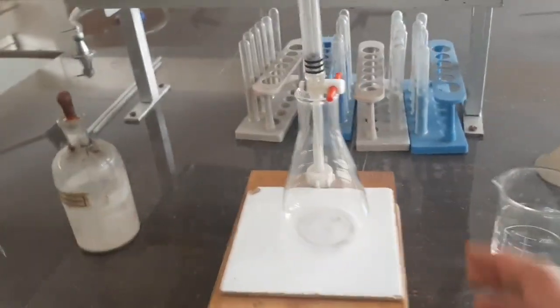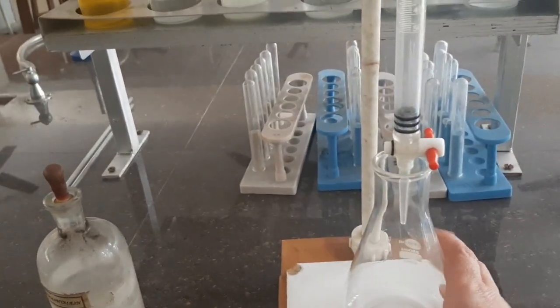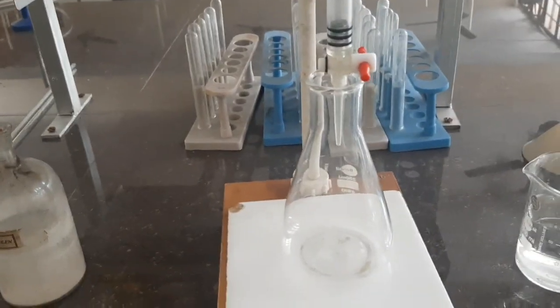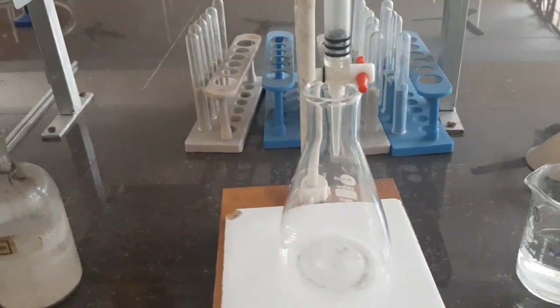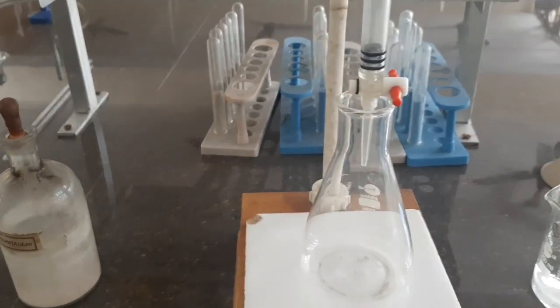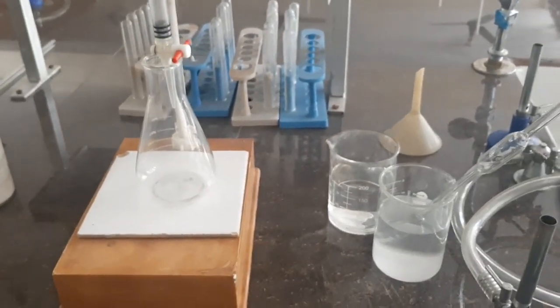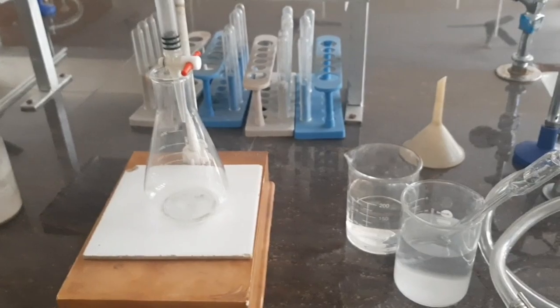The titration flask, however, is just to be washed with ordinary water after every reading. We will be washing it with water after each titration.